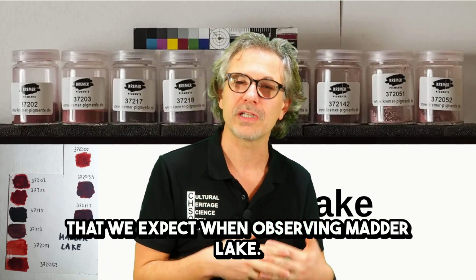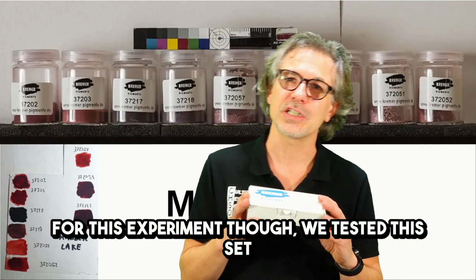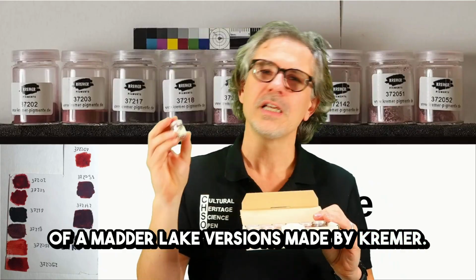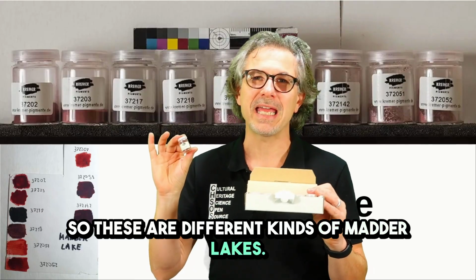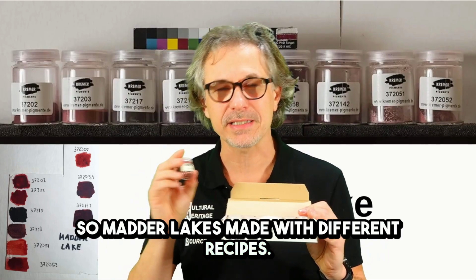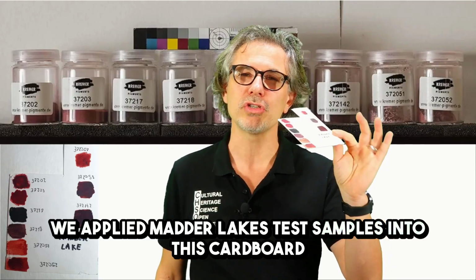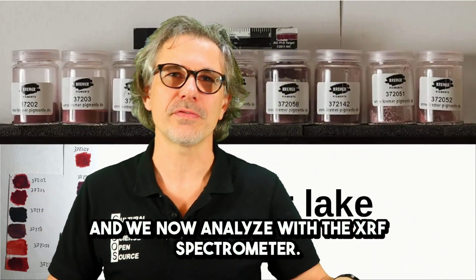when observing Madder Lake. For this experiment, though, we tested this set of Madder Lake versions made by Kremer. So these are different kinds of Madder Lakes, made with different recipes. We applied the Madder Lake test samples onto this cardboard, and we analyzed them with the XRF spectrometer.